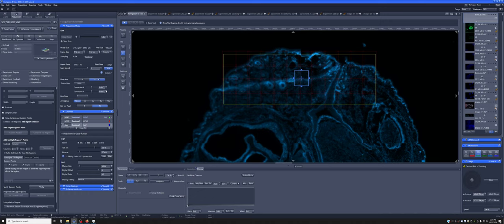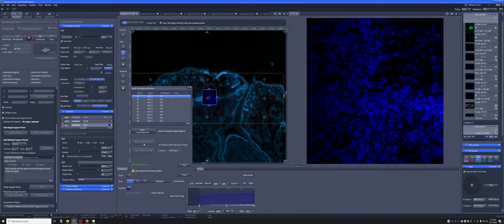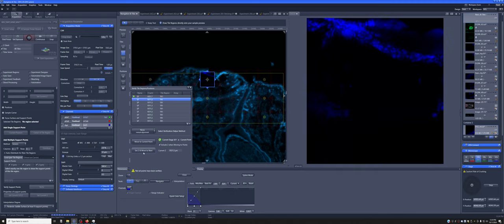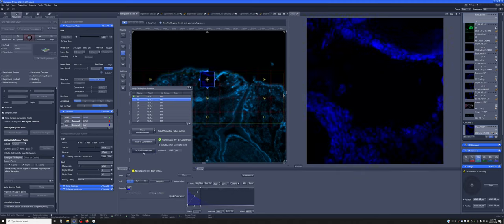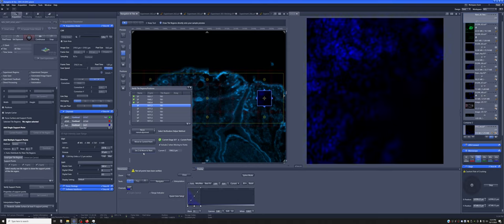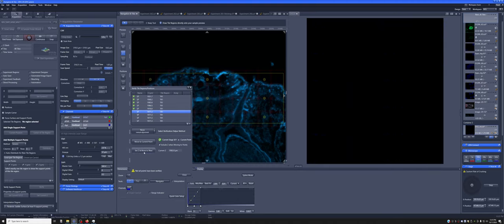So if I select that, and once I have this tile selected, let's say I want to add 3x3 generic points. It adds these anchor points, and then if you go to verify and go to live, we can move to the current point. We can go here and adjust the focus until we have something, set Z and move to next. Similarly, adjust it here, set Z and move to next. And as we do this, we're giving it a map of how it's tilted, essentially.